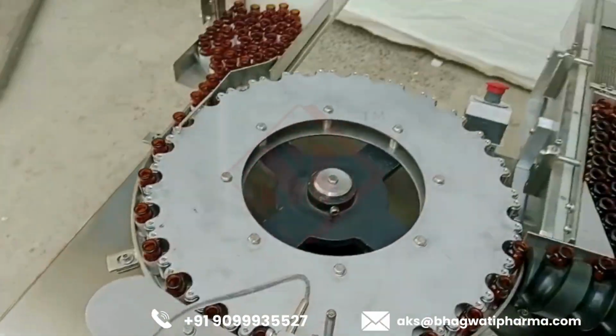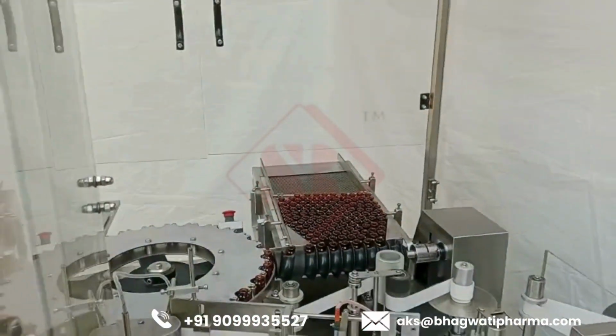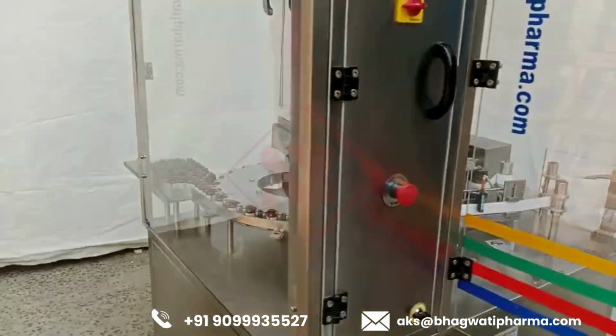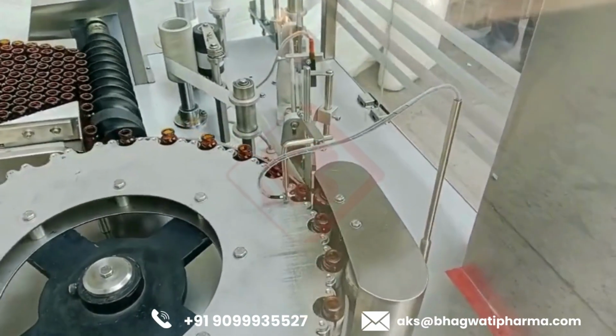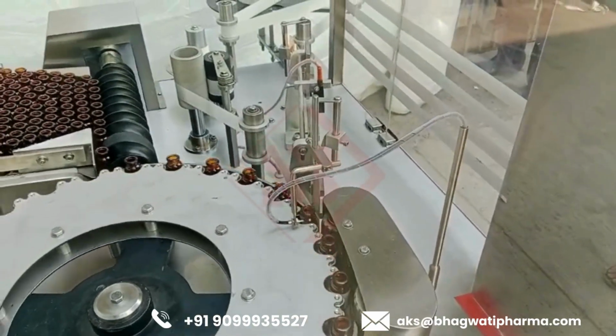Rotary design. The machine typically has a rotary configuration, where the vials are transported along a circular path to undergo the labeling process. This design allows for continuous operation and high-speed labeling.